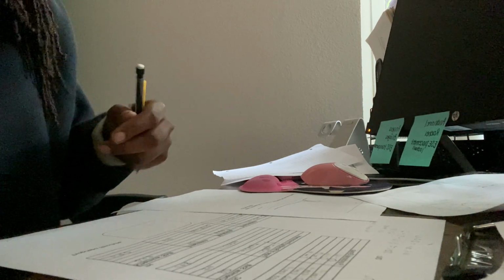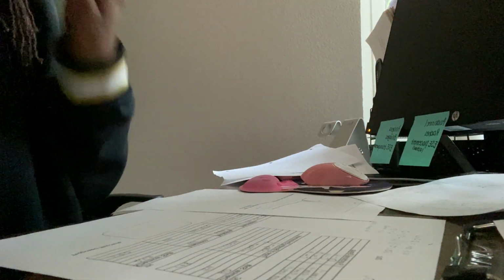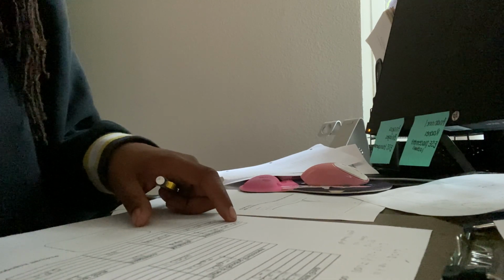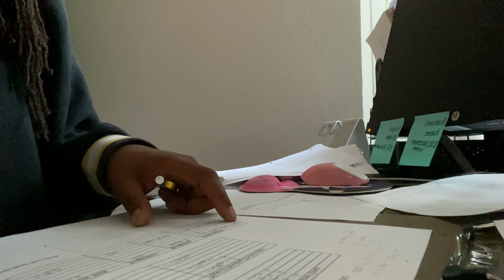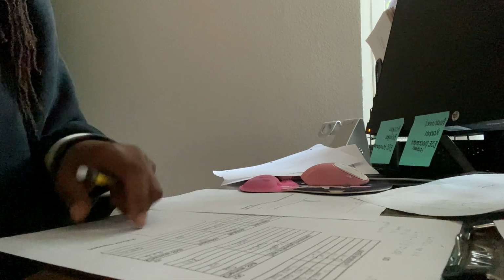How I propose my structures, based off of just the repetition and everything, is just putting everything together. Again, this makes it easy. The interpretation of the 1H NMR and the chemical shift 2.43 makes it a lot easier because I already have my base.